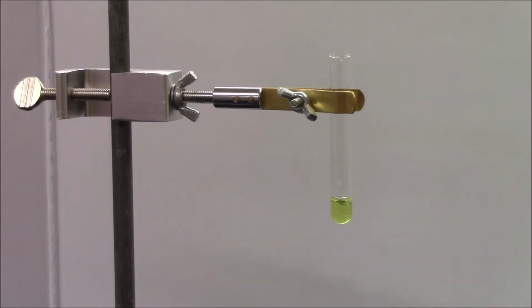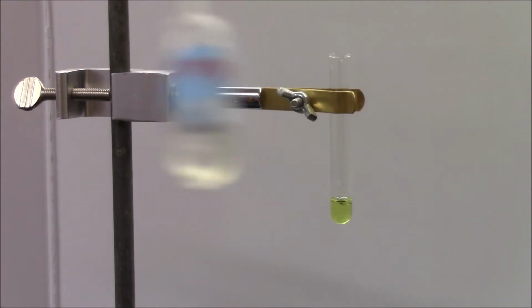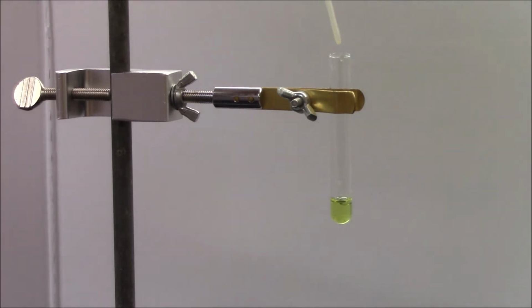And to it, I am going to add sodium phosphate, Na3PO4. And when I bring this into the screen, again, you can see that it is clear and it is transparent, or colorless and transparent. When I add this, what you should see is that it is becoming cloudy. It might be difficult, but there is a white solid in there. We're going to write down that the solution became cloudy and that a white solid formed.